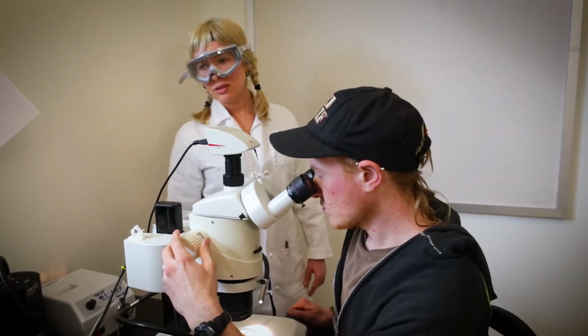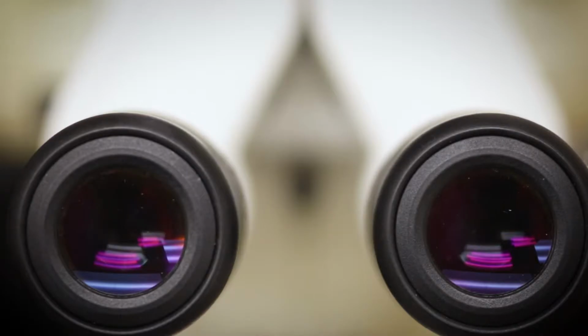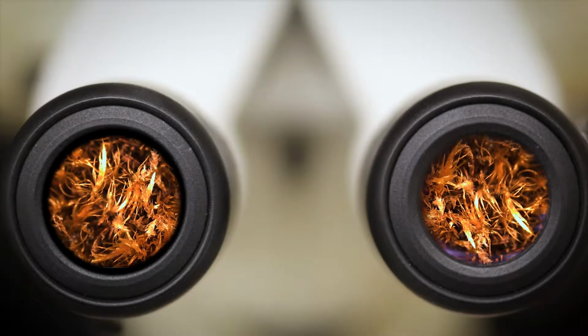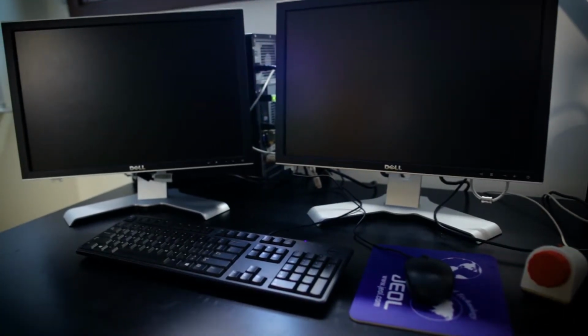Before you move on to the software, take some time to adjust the light sources, Z-stack height, and magnification by looking through the eyepieces until your subject is well illuminated, in frame, and at least partially in focus. Now that you've familiarized yourself with the physical components of the instrument, let's turn to the Leica Application Suite Multifocus module.